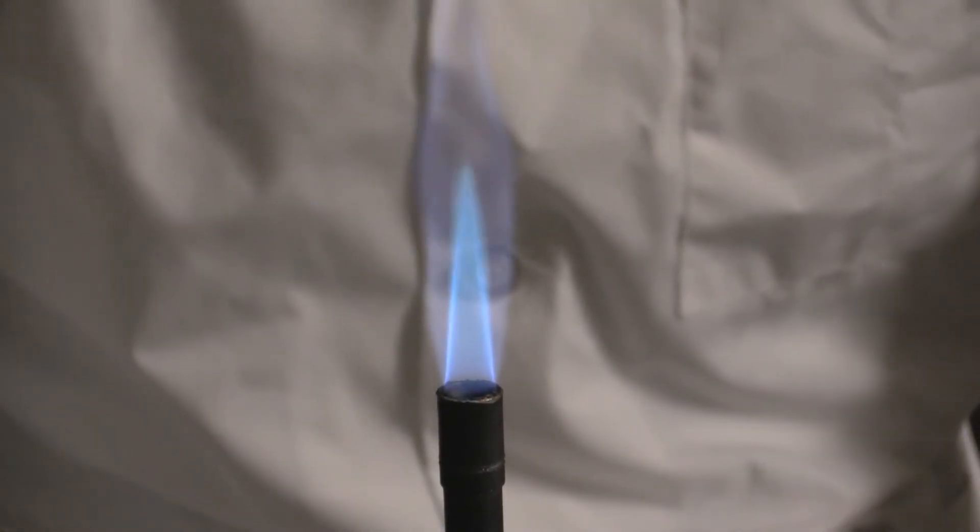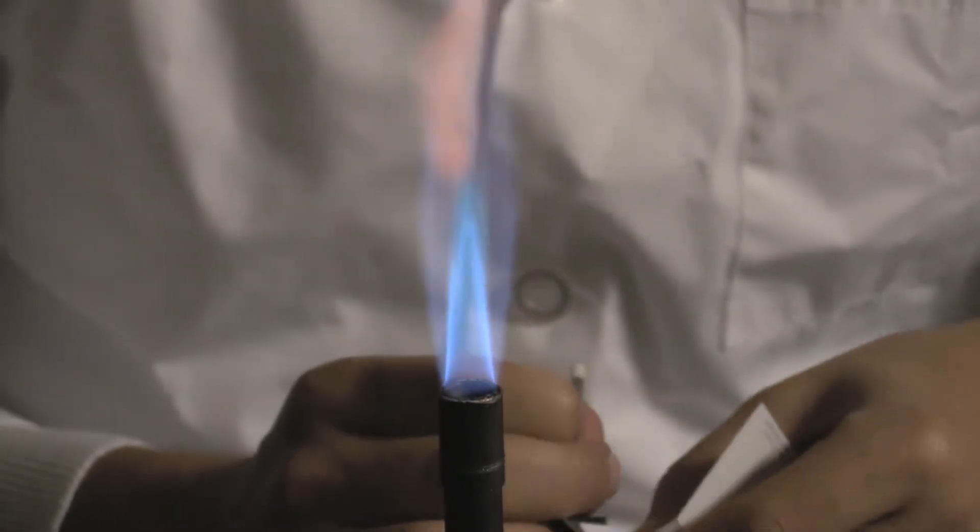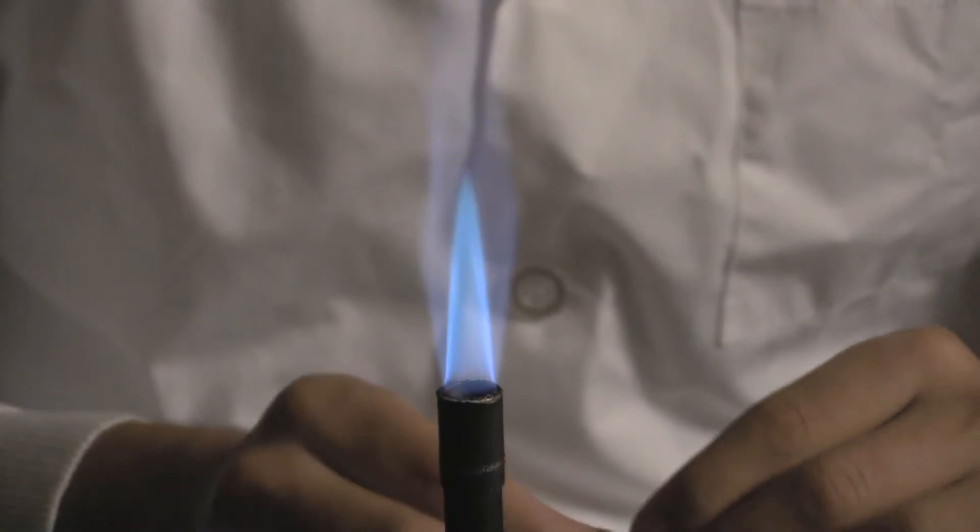Play with these two settings until you get the blue cone. It is the top of this blue cone that is the hottest part of the flame.